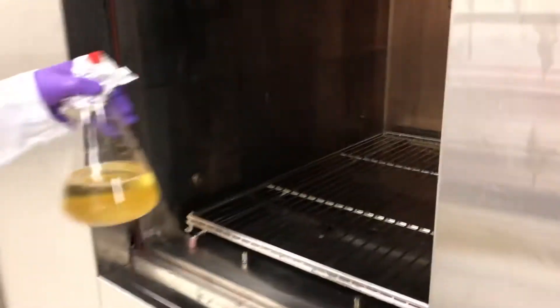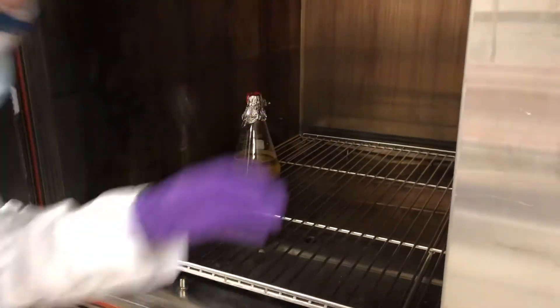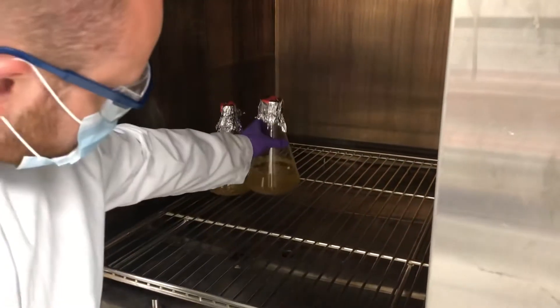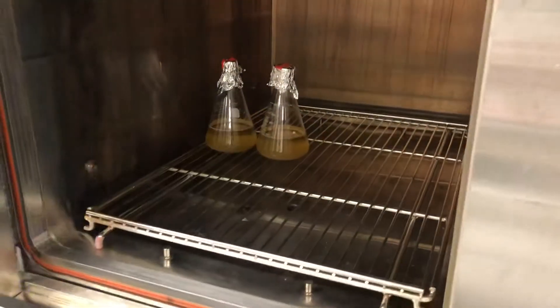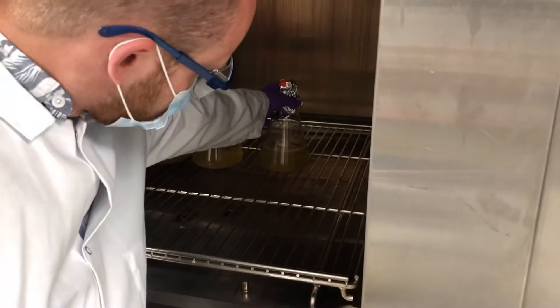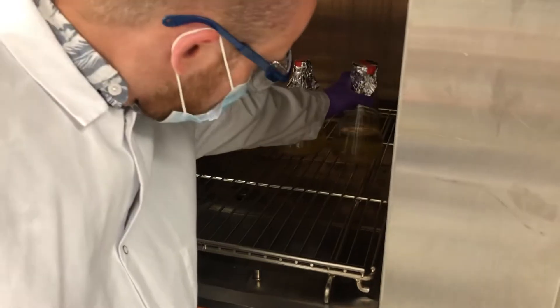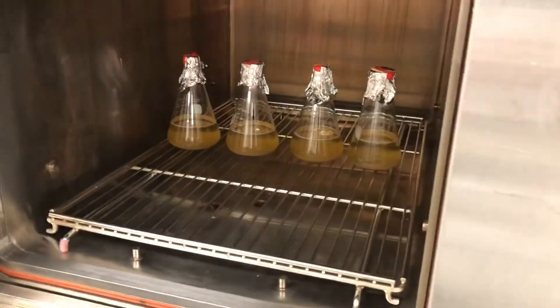Put these in. When they're cold, it's okay to put them in using two hands or two flasks. Don't have them touching each other — space them out, just enough so that they don't touch each other. The first placement was perfect. As long as they're not at risk of knocking against each other, you're doing good.